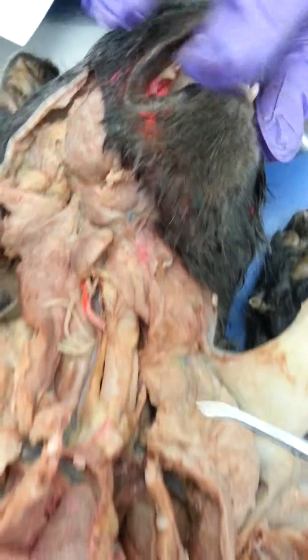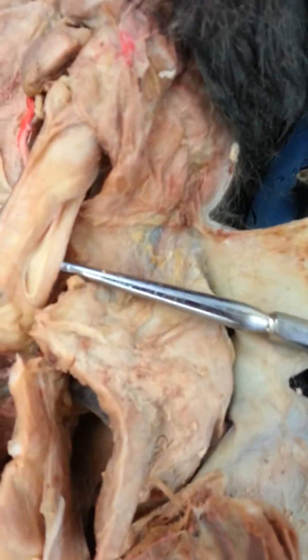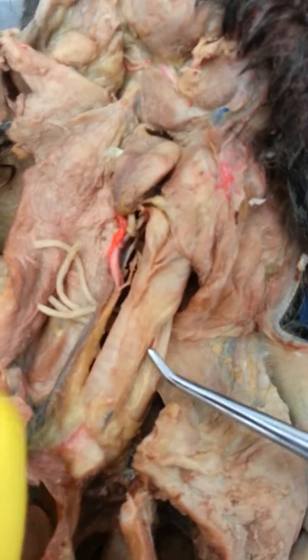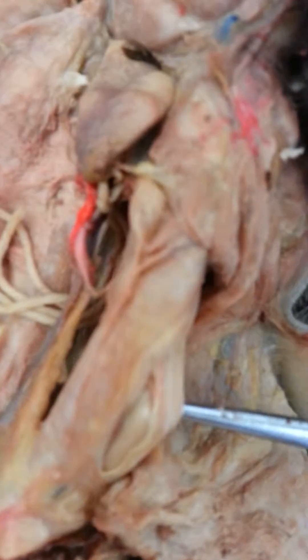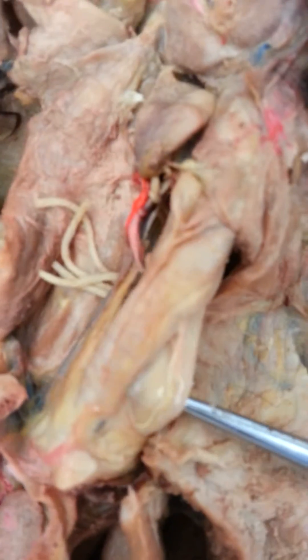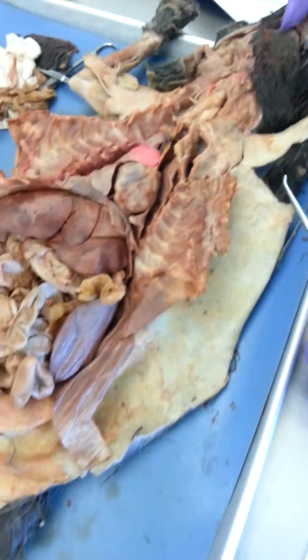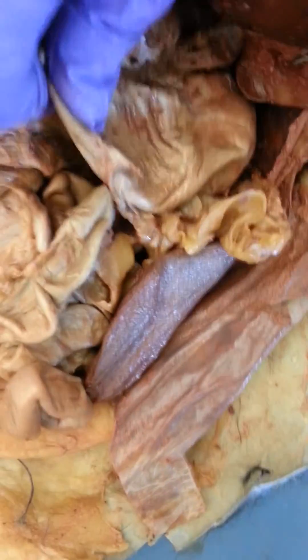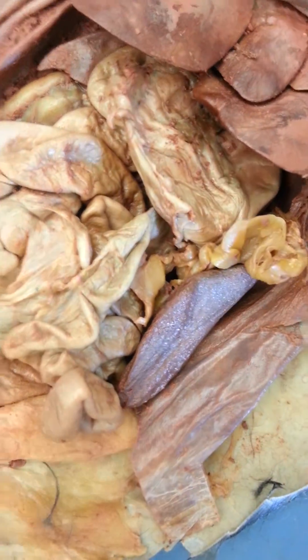The esophagus is behind the trachea — this one right here. The trachea has little bones; it doesn't look like the rest of the trachea. There's the esophagus. The stomach is down here, and the esophagus enters at the top.